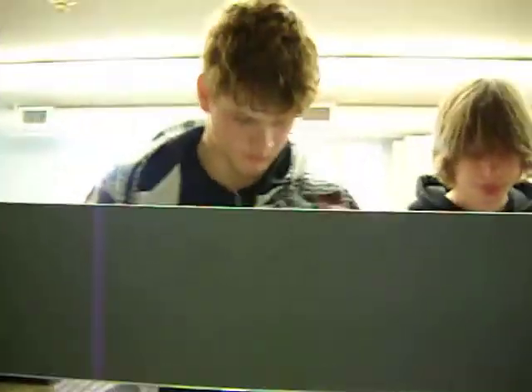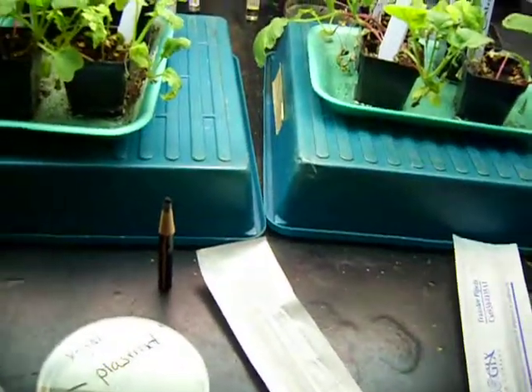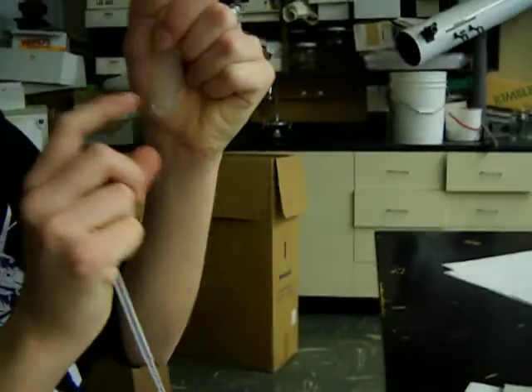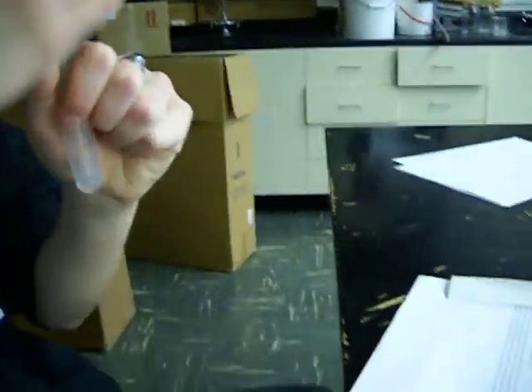Okay, are you guys ready? Is yours at room temperature? Hey, I can see the pencil and it's standing. Whoa. I don't know how long it is yet. Check it out. What is this? That little stuff? Luria broth. That stuff, yeah. I'm gonna do the next one. It's set.